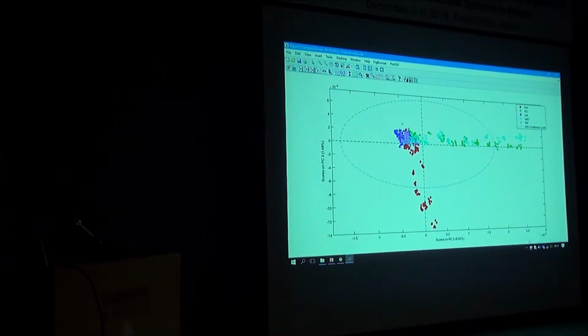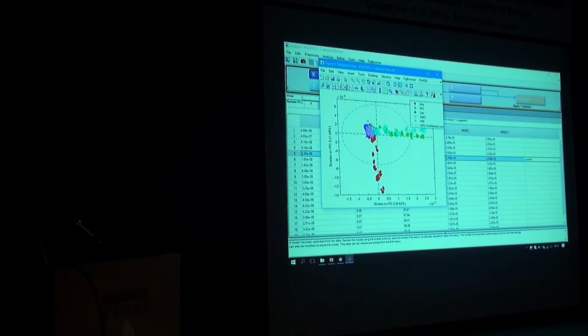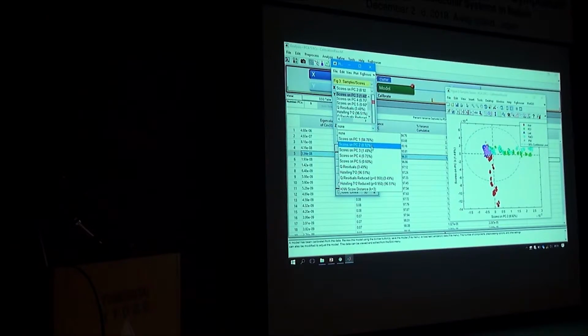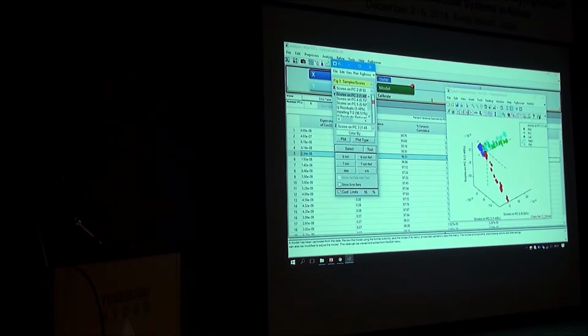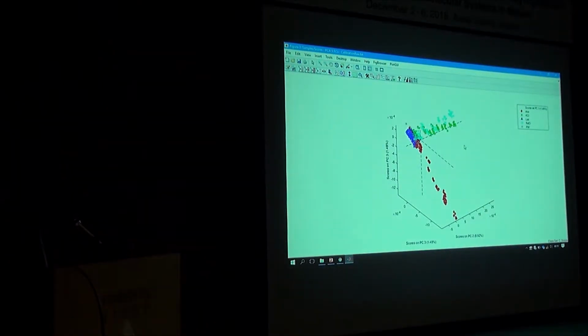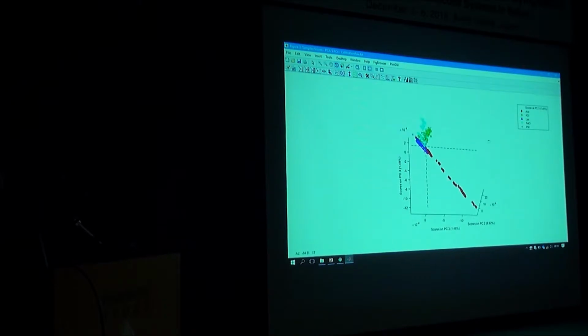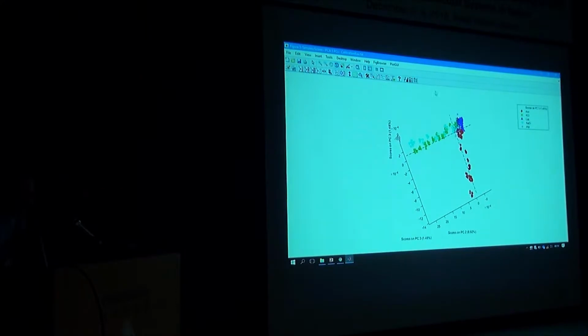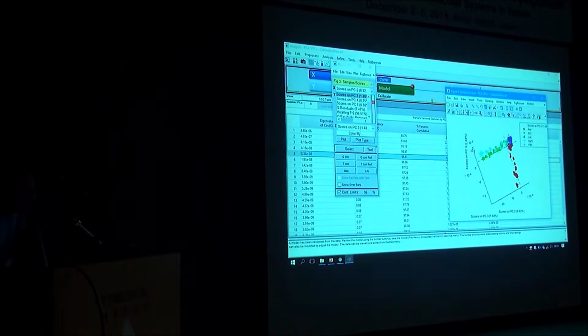So you got 3 distinct directions. I can even make it 3D. So if we add a third principal component as a third dimension, you can see that lactate, which is organic, is extending into a third direction. So let's rotate it. Oh, I think we don't have the third. Okay. It's 1, 2, and 3.